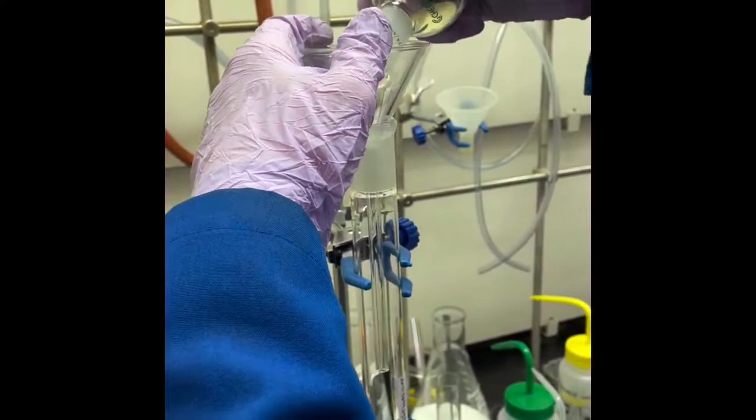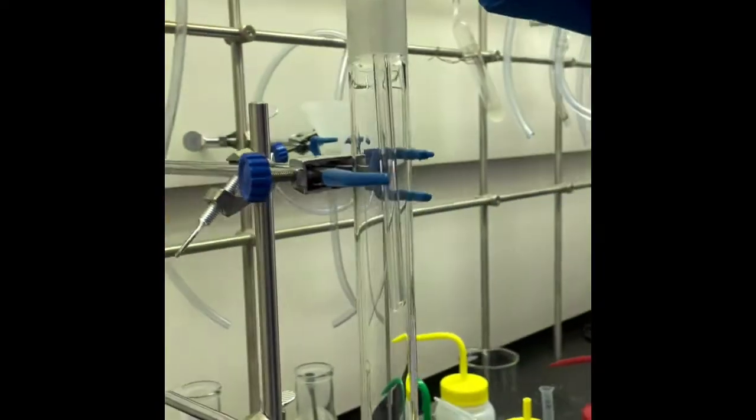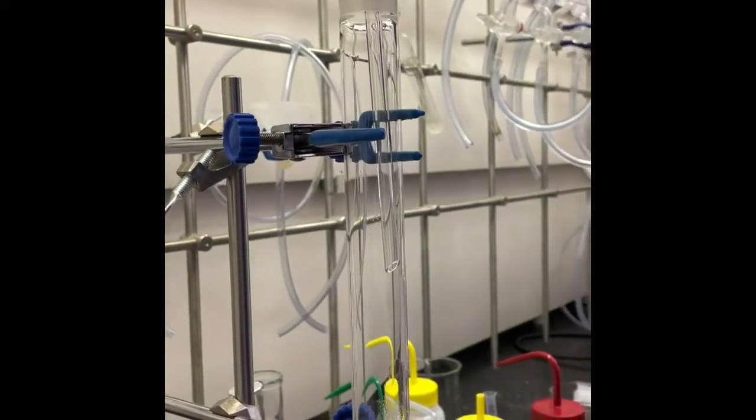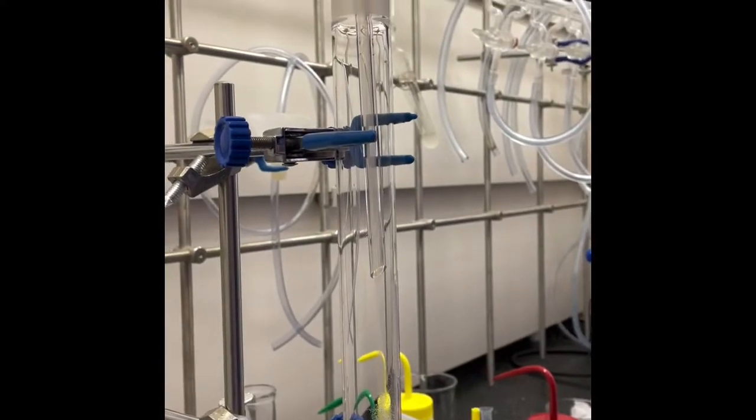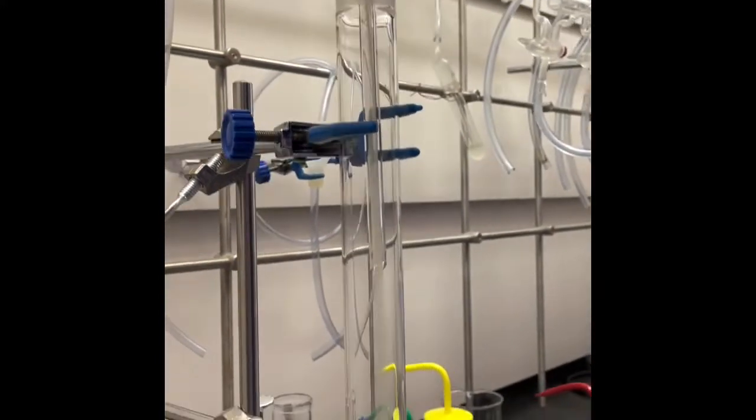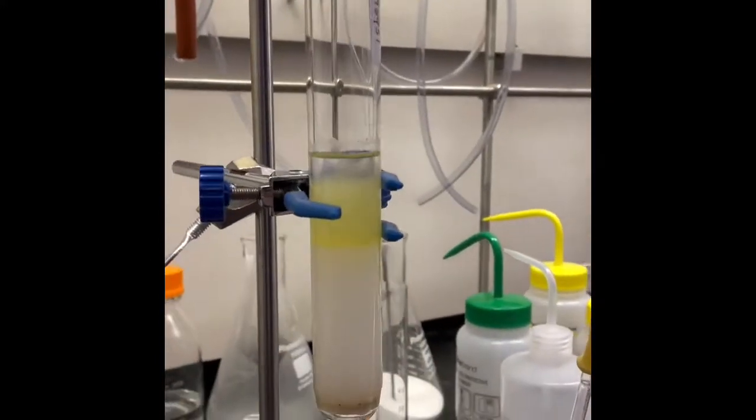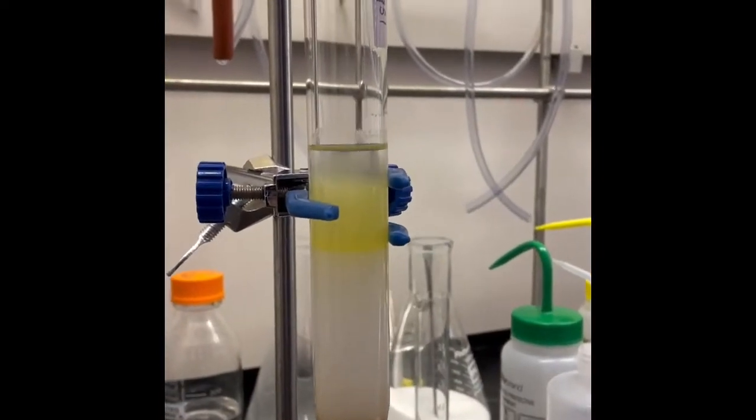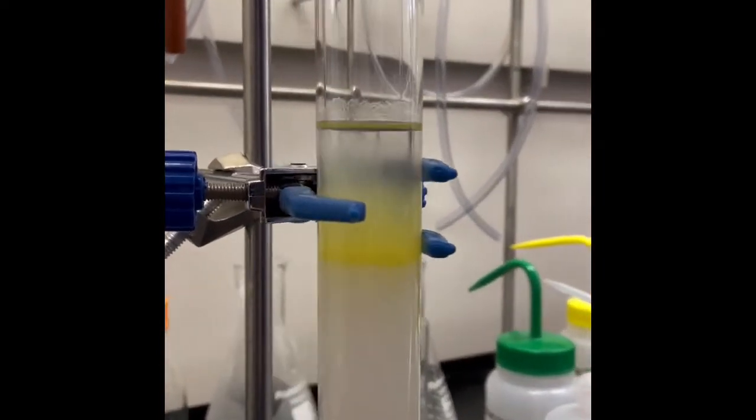After 24 hours, the blue light is shut off and the reaction is filtered and evaporated. The compound is dry-loaded onto a silica column, as shown. The column allows us to separate the desired product from the other organic compounds in the reaction mixture.